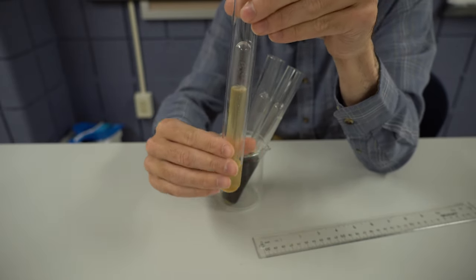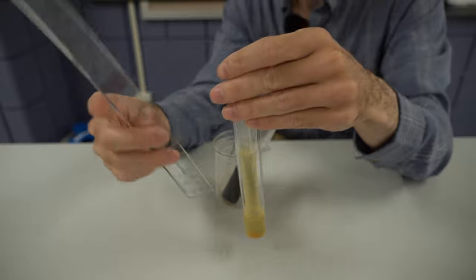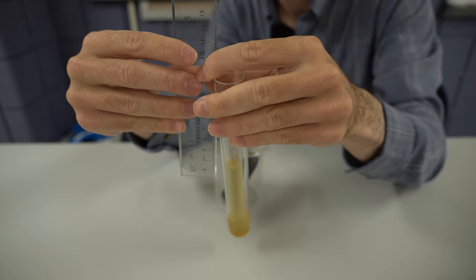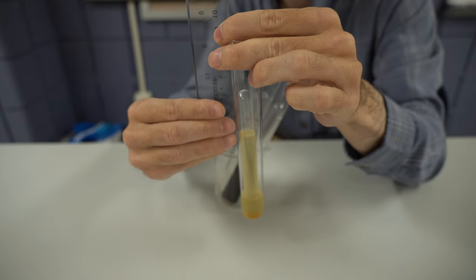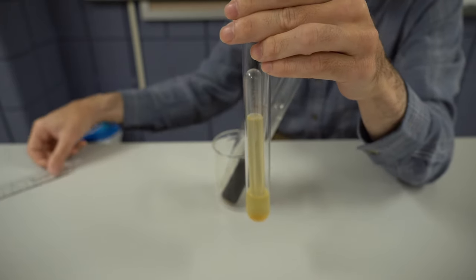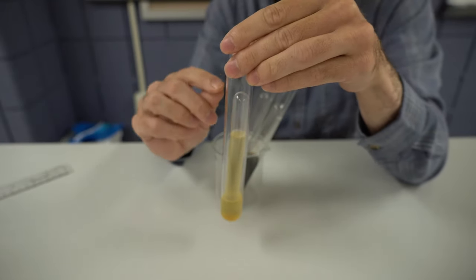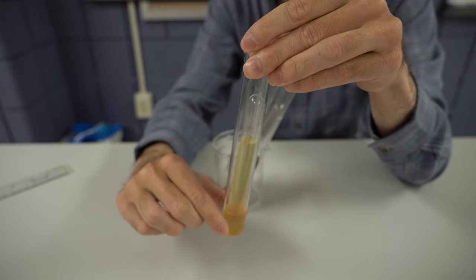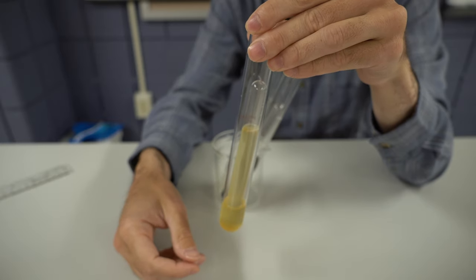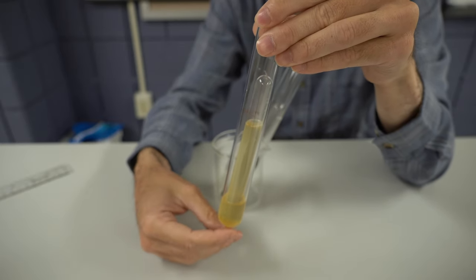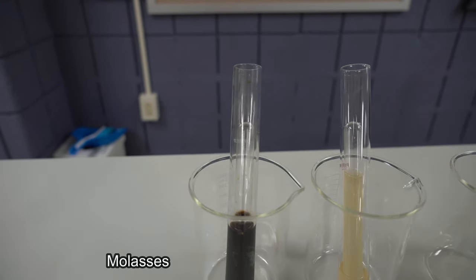How are we going to quantify this? Well, we're simply going to take a ruler, and we're going to measure in millimeters the height of that bubble. So we're going to go through, and we're going to take the area from the height of that bubble to basically the height of that test tube, and measure that, and compare that to our reading we originally took when we initially flipped everything over and got the initial bubbles. We left usually just a little bit of a bubble there to begin with. Now we're able to see how much gas was produced directly correlating to the amount of yeast here, the population of the yeast in this sugar solution.